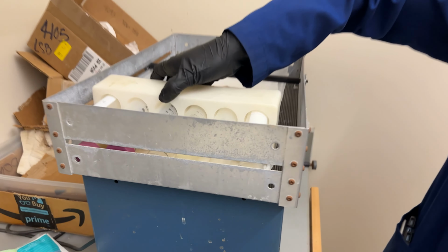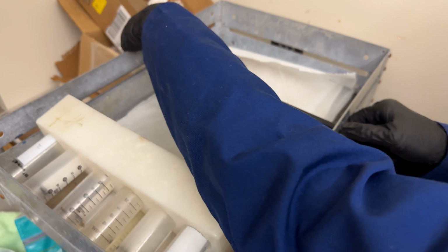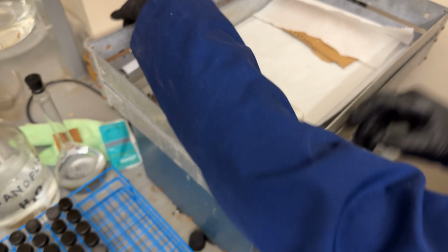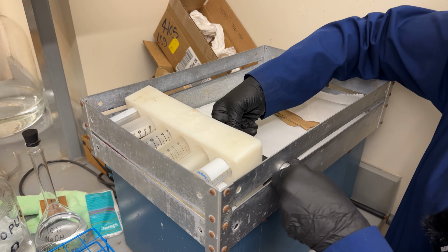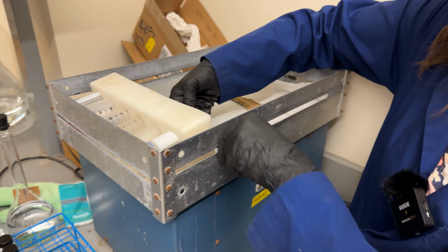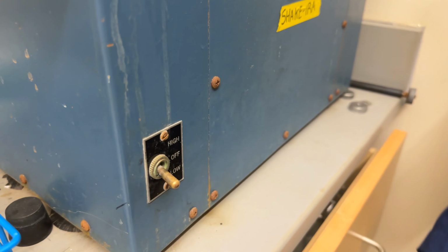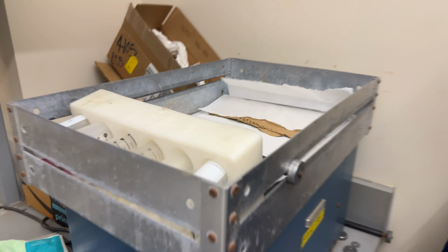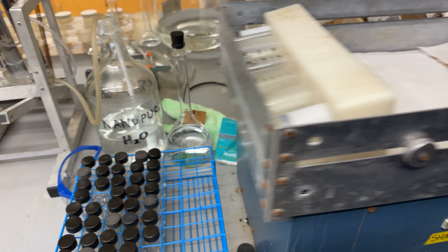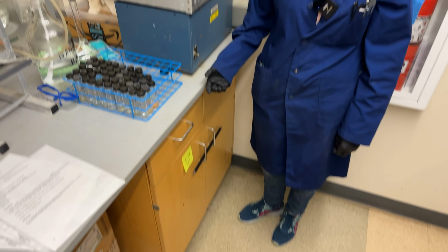So you'll put this into the shaker, and then you're going to adjust this bar so that it secures those samples in so that they're not moving around too much. Once that's tight, you go ahead and put the shaker on low. And make sure that the lids are screwed on tight so that they're not leaking. And we'll let that shake until it's done. And then we'll pretend like it's been the amount of time.